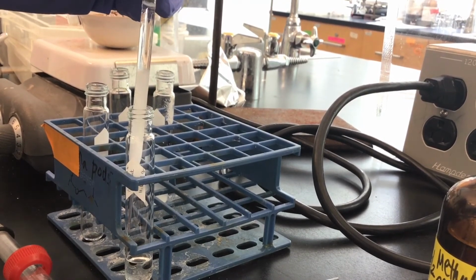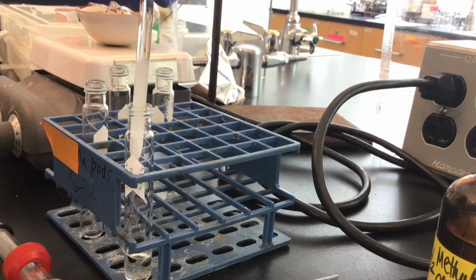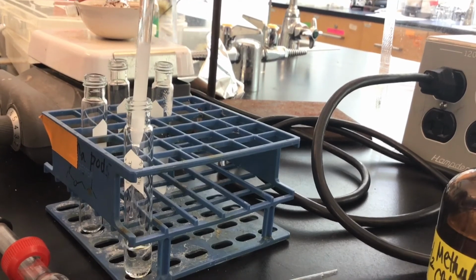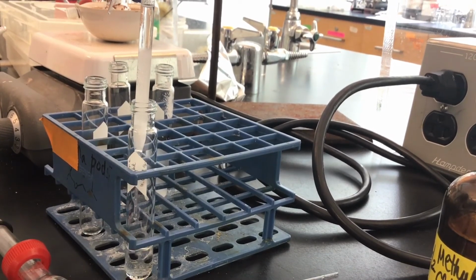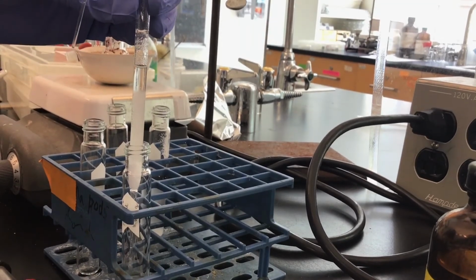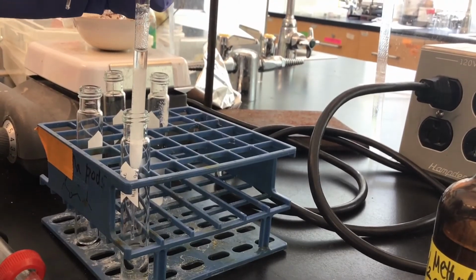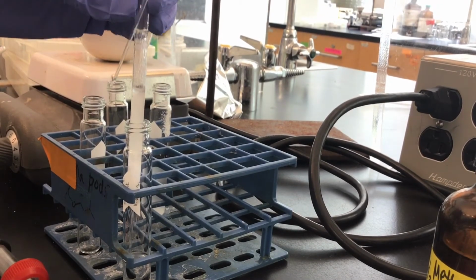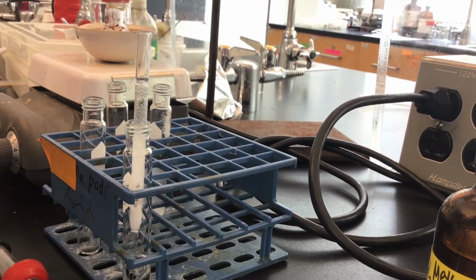If it were a slower rate, that would indicate that your organic layer was still really wet, and the sodium sulfate took on so much water that it acted more like a stopper than anything else. It could choke the filtration if you had too much water.